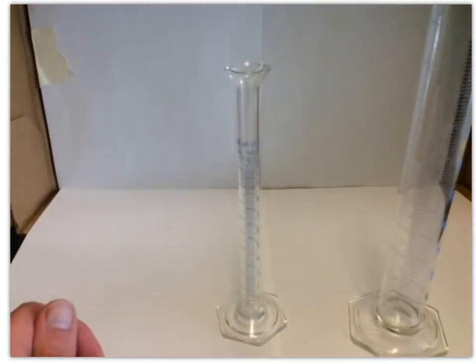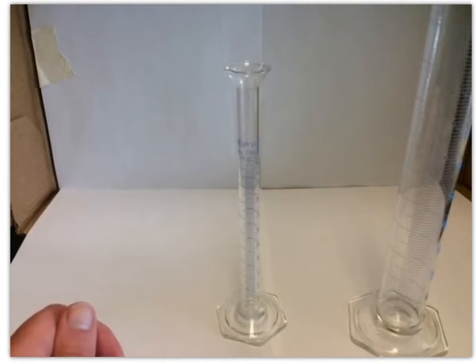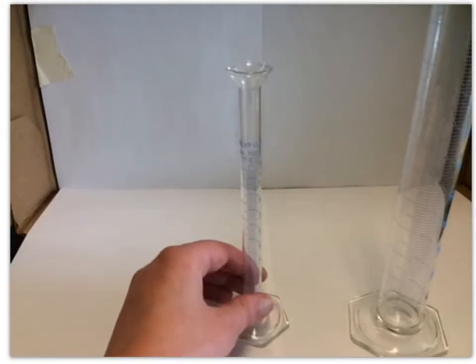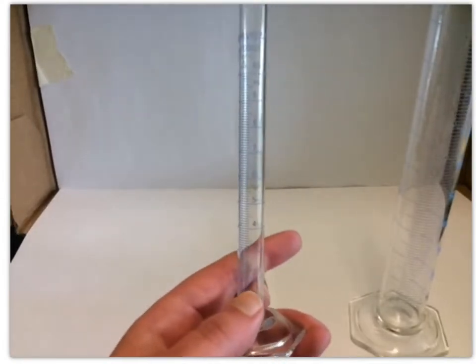But when you take measurements in the lab, it's important that you know how to properly read a scale and not just get the numbers like 1, 2, 3, 4, but know how many decimal places you need to report in these values, or if there should be decimal places. It would all depend on the measurement markings on that device. We're going to look at these two because we're going to be using them a lot.